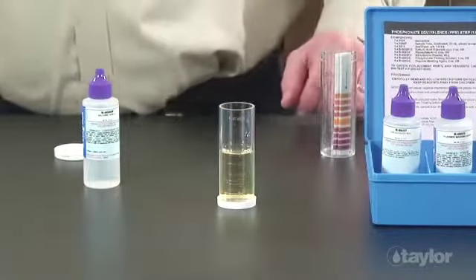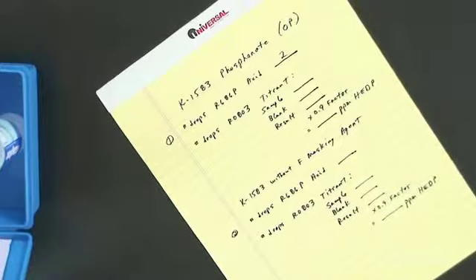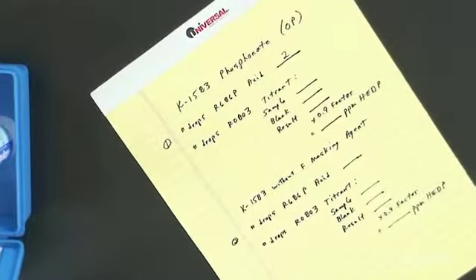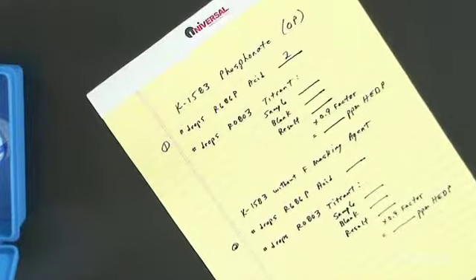We suggest recording the number of drops of sulfuric acid used, so on return visits you can save time and test paper by having an idea of how many drops of acid to start with. Once the sample is at the proper pH, it is ready to be titrated.